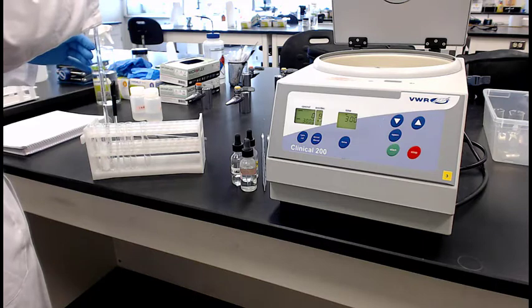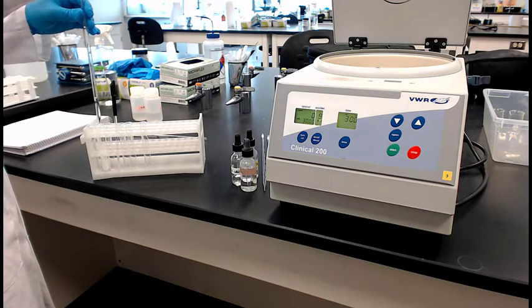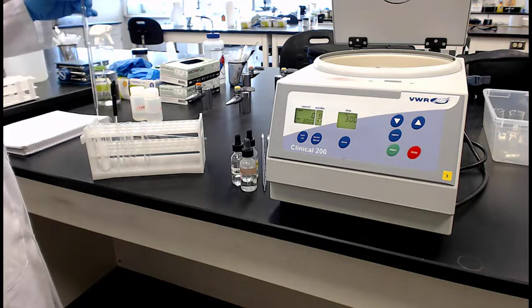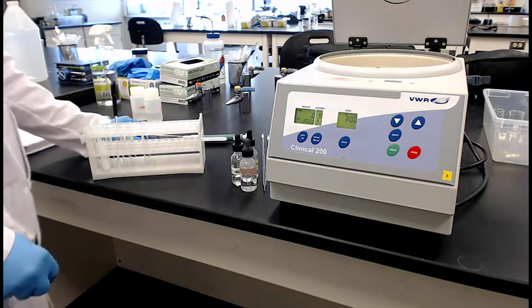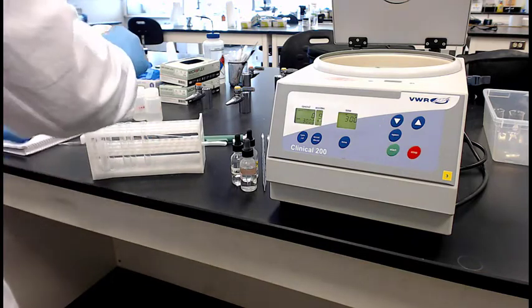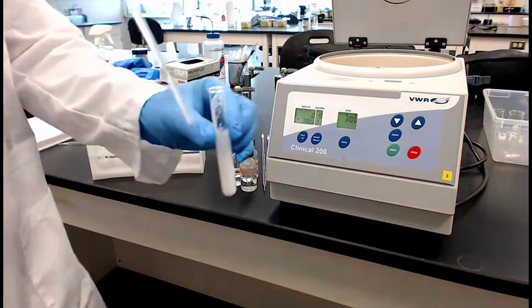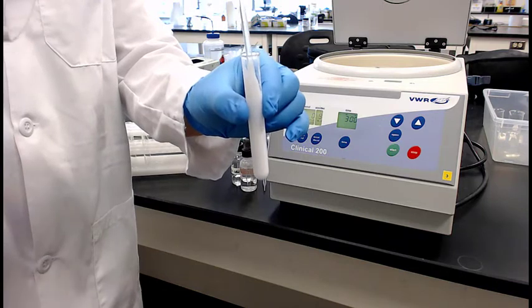So if you wonder how this is happening, what he's doing is taking a little at a time from each of the tubes and putting them in a third tube and mixing them. So he's not doing too much at once. If you just took the two tubes and mixed them all in one batch, it's a busy reaction and you might have problems. But now that, okay, this helps. Now you can see what you're doing is making the solid.